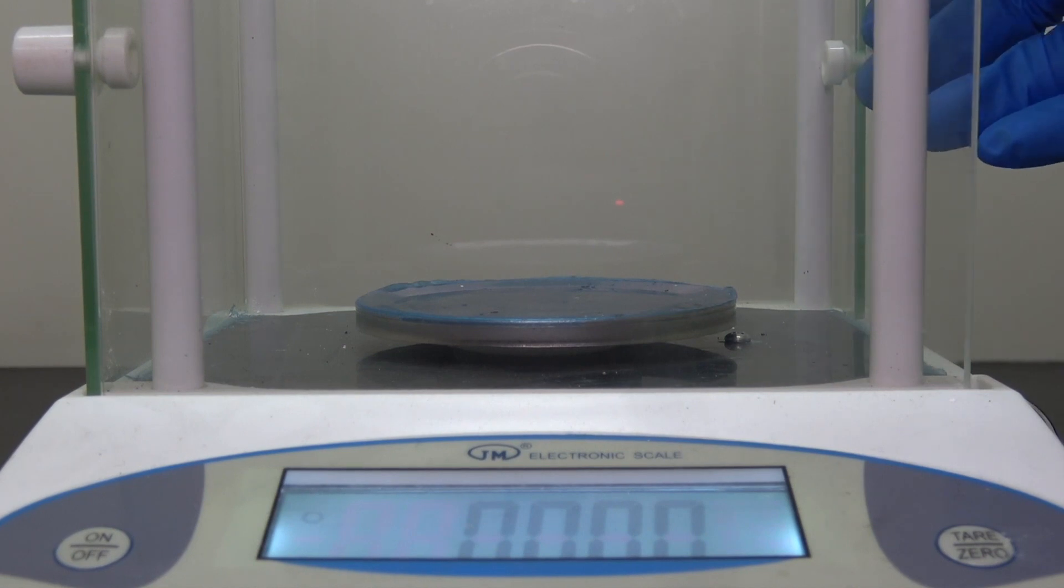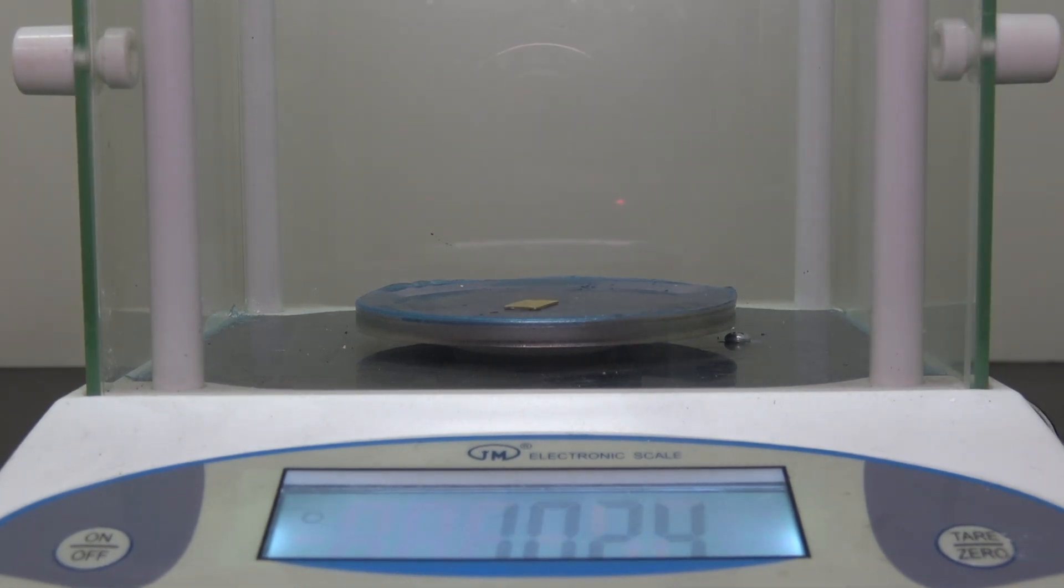Anyway let's check if there is a loss of mass. Looks like no mass is lost, at the sensitivity of my scale at least.